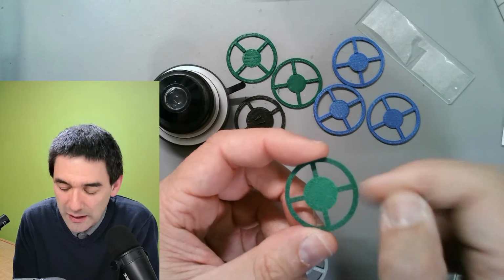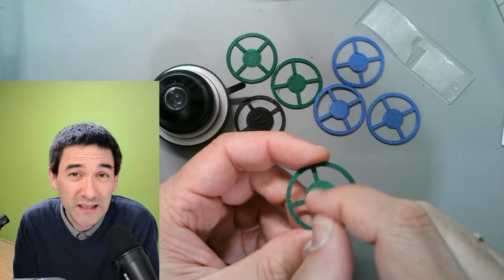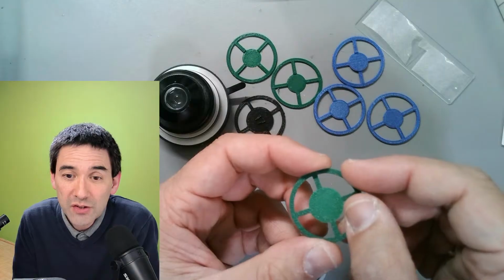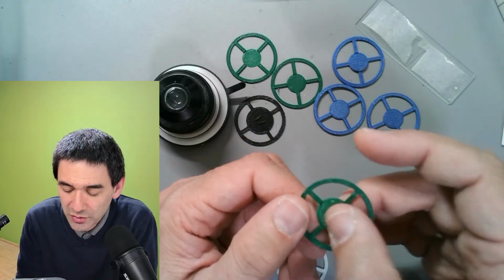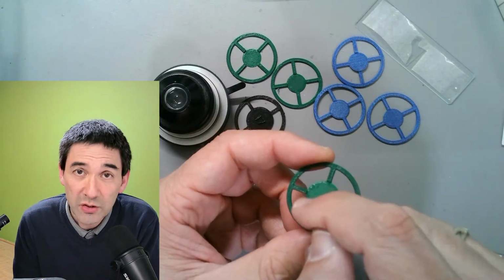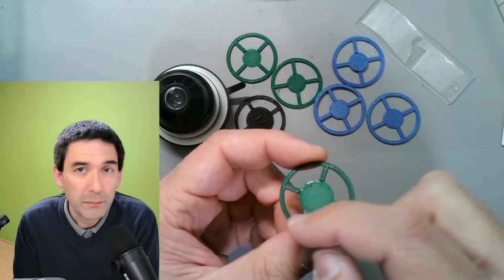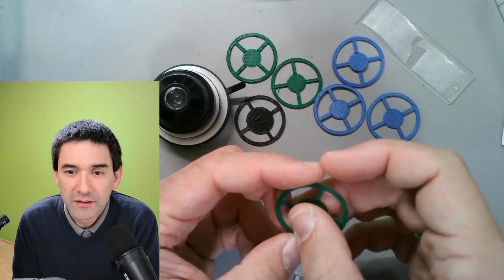I found out that this is actually quite sensitive. If the central patch stop is just a little bit too small, you will not get a properly dark background. That is what I just want to inform you. Therefore, I would sometimes suggest trial and error. You can use some felt tip markers or some cardboard and glue it on a transparent plastic disc, and then you can play around with that.